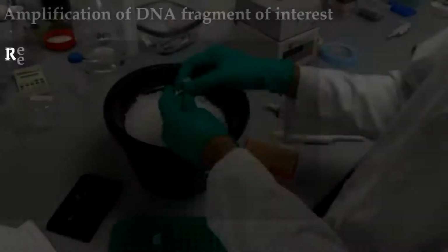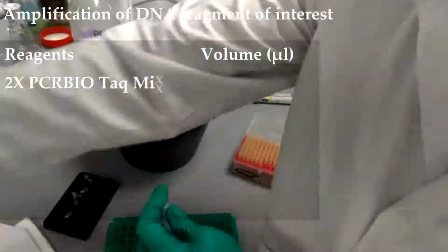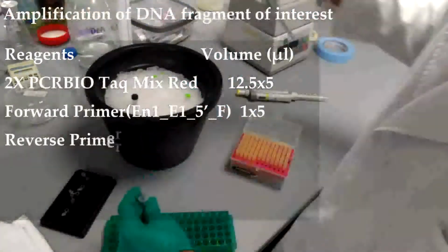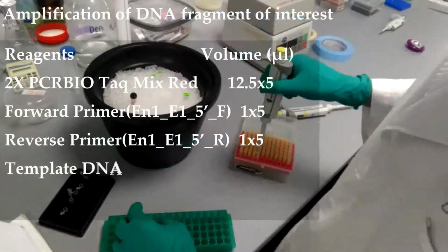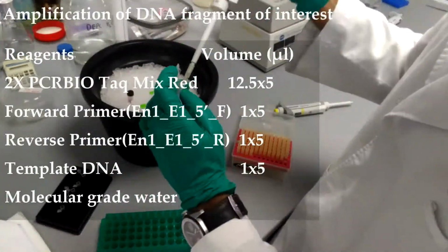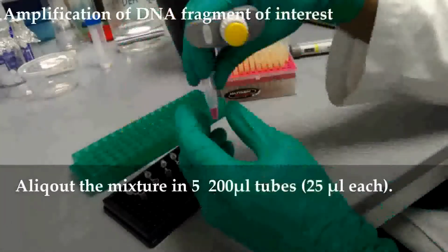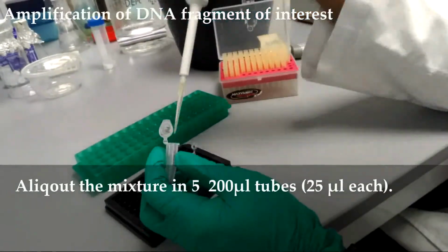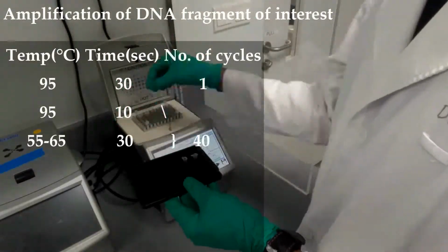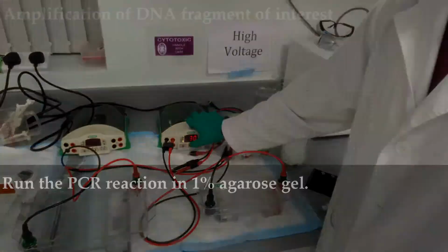Amplification of DNA fragment of interest. In a 1.5 ml microcentrifuge tube, add 62.5 microliter 2x PCRBIO Taq Mix Red, 5 microliter forward primer, 5 microliter reverse primer, 5 microliter template DNA, and 47.5 microliter molecular grade water. Vortex the mixture. Aliquot the mixture in 5 200 microliter tubes. Set up PCR reaction with settings as shown on the screen. Run the PCR reaction in 1% agarose gel.